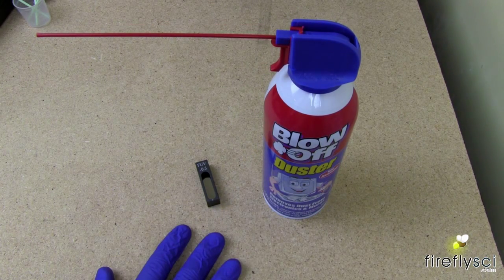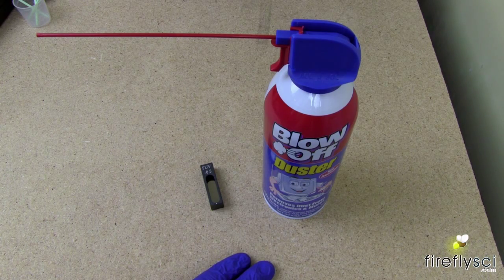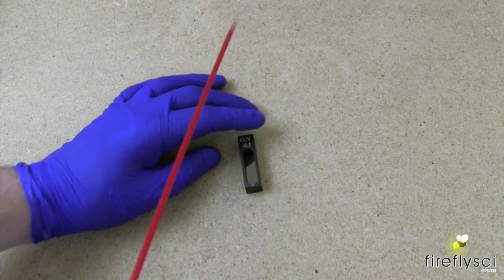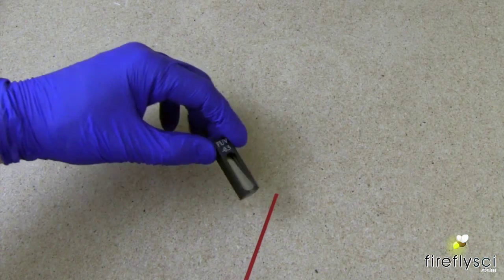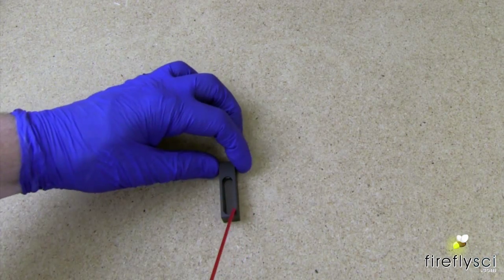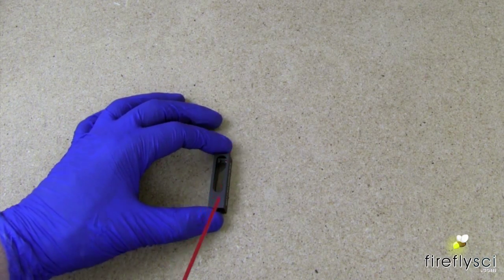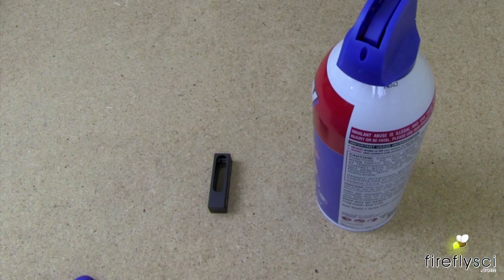It's important that you don't use the air line in your lab because this can have dust or dirt in it and it could damage the optical surface of the calibration standard. To clean a solid filter with a can of compressed air, simply lay the filter on a clean surface, take your can of compressed air, make sure you hold the filter in place or you'll blow it away, and give it a quick shot. You can turn the filter over and also do the other side. This cleaning will remove any dust or small particles from the optical surfaces.